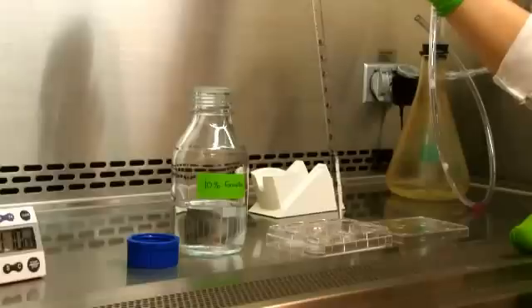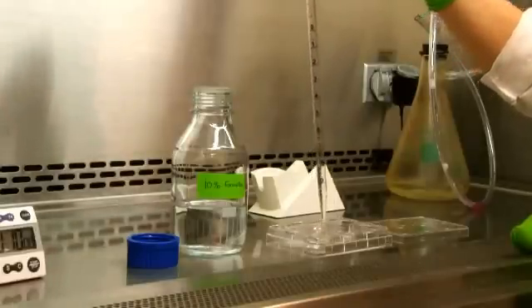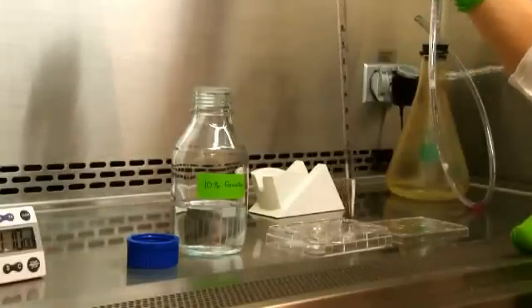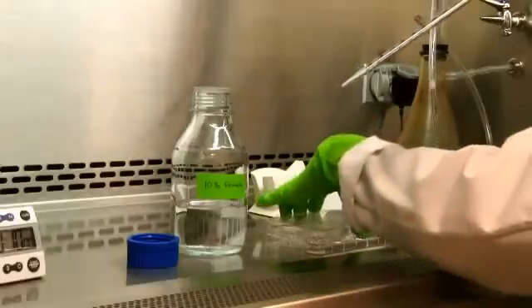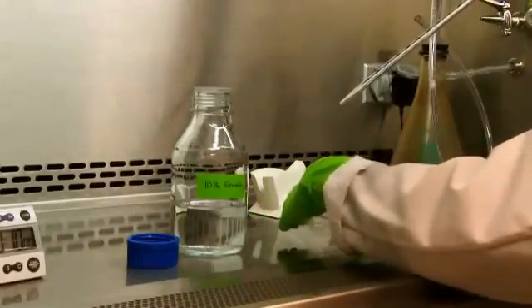Start by aspirating culture medium from each well, followed by fixation of the cells with 4% formaldehyde or 10% formalin for 10 minutes at room temperature.